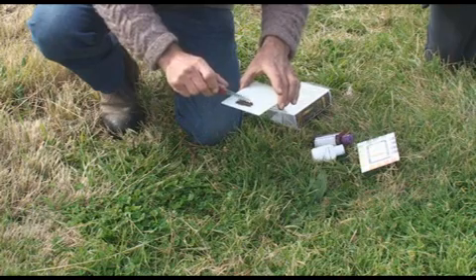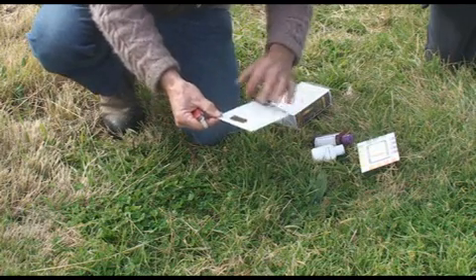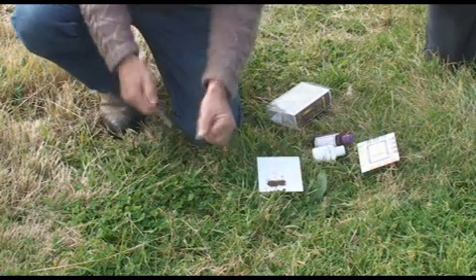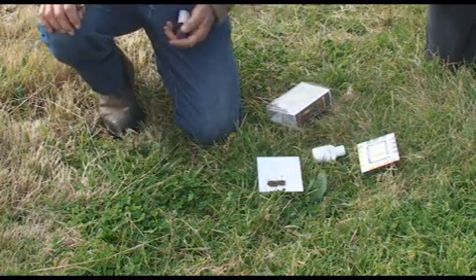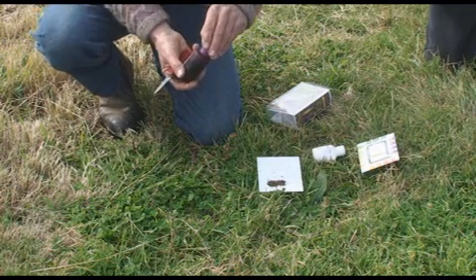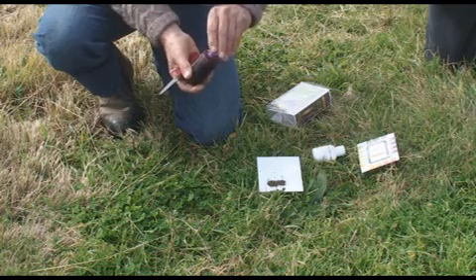If there are large pieces of organic matter, flick them out because they're always going to be acidic — like plant roots, etc. The rhizosphere around a plant is always the most acidic part of the soil. We're really looking for the overall pH, or background pH if you like.